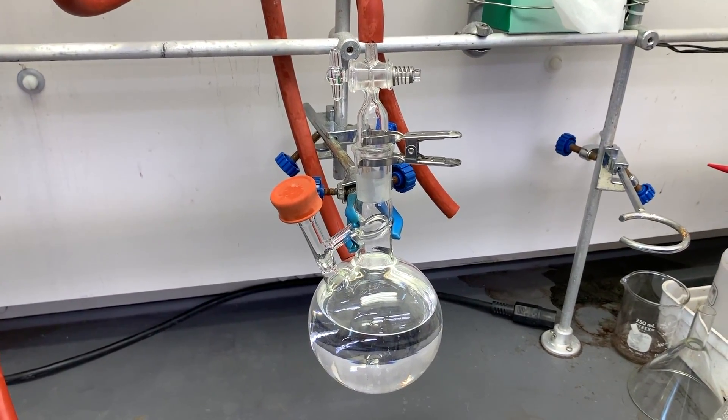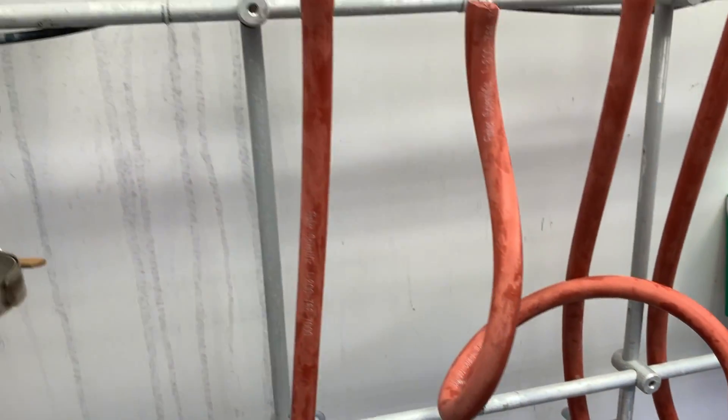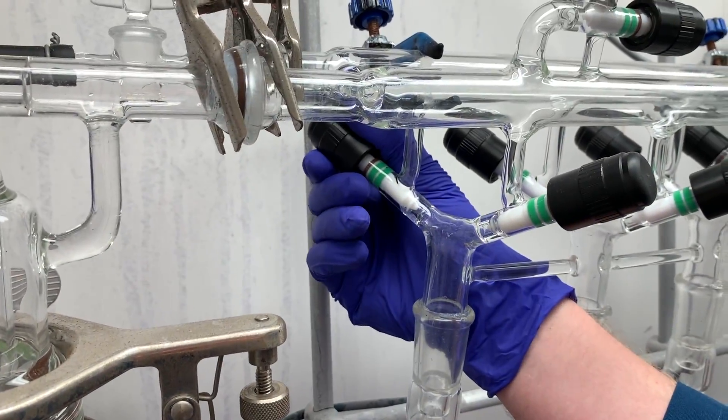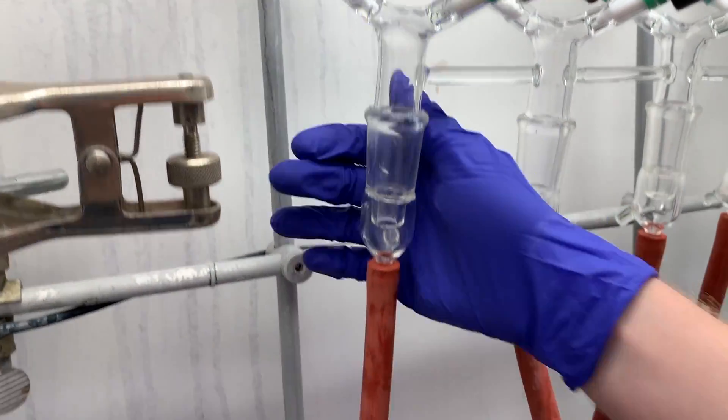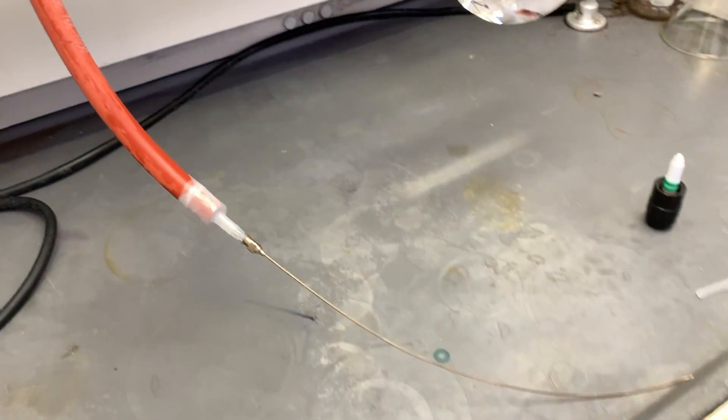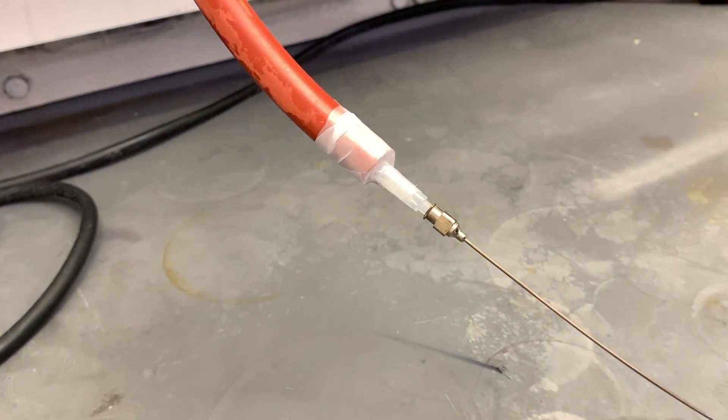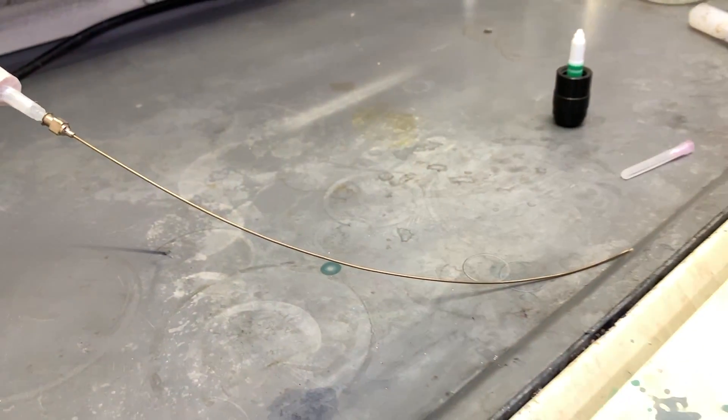On the second tap, attach a long needle to the hose. We're using a plastic syringe barrel here to make the connection. But a big safety note: needles can poke you and that can lead to injury and exposure to hazardous substances. Please be careful.